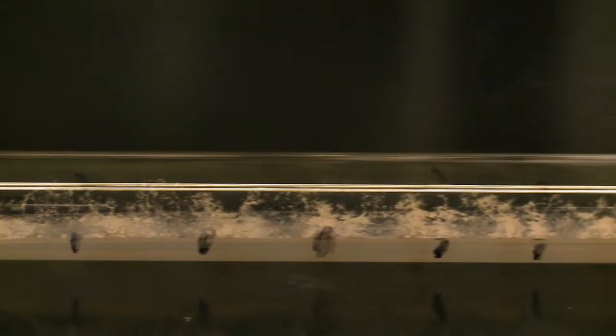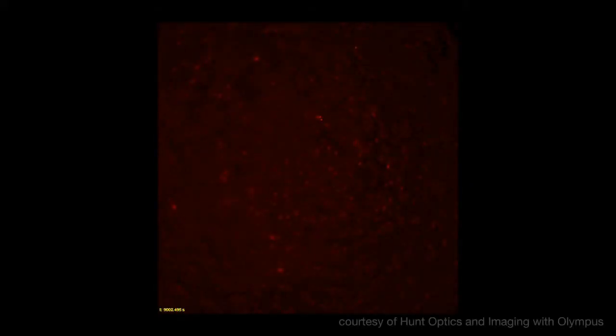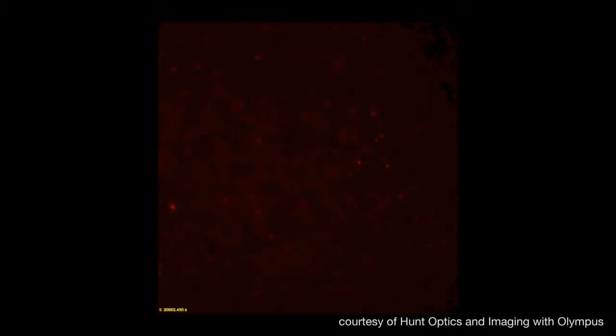And what we see here, as the organism grows down the tube, these little bands, and that's the organism reproducing. And that reproduction takes place every 24 hours. Most experiments that are done on the biological clock have involved measurements on millions and millions of cells. Various strains of this organism have been engineered so that we can actually look at the behavior of the clock in individual cells. The challenge, though, of doing this is those cells are floating around in a solution, and so it makes it very hard to track what they're actually doing.